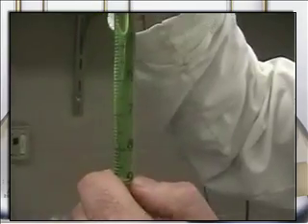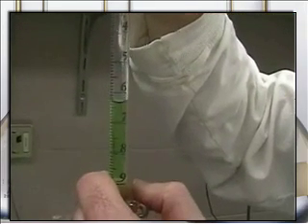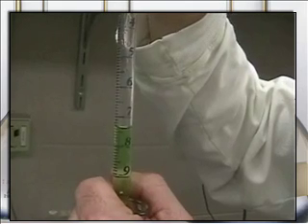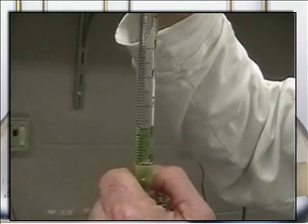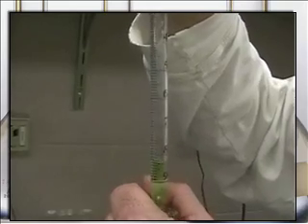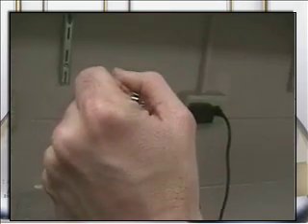So I'm going to now allow the liquid to draw down. Notice I'm only releasing the pressure. I am not just taking my thumb off. I'm going pretty quickly. This is kind of an acquired skill. You will get better at it as you do this. You will make lots of mistakes at first. Boom, 8.3. So I stopped at 8.3. Notice there's still a little bit of green stuff left over. I'll just put that back in the stock solution.